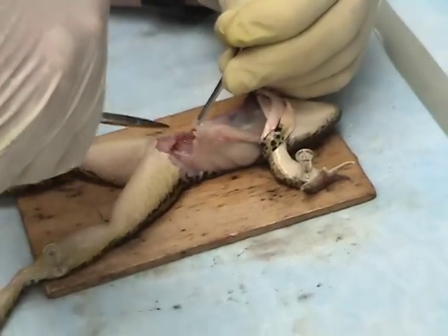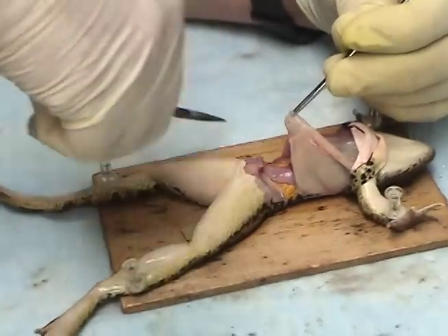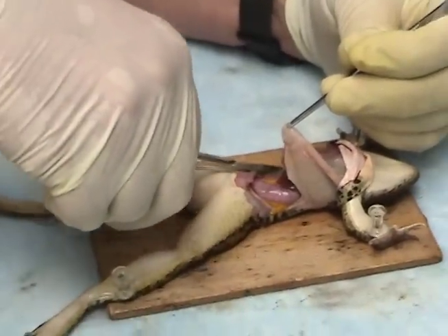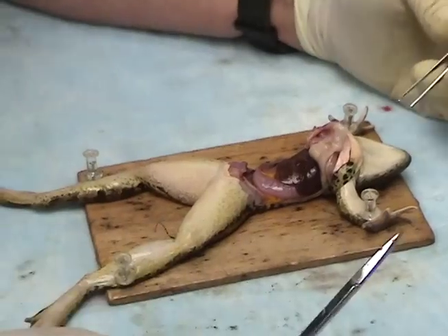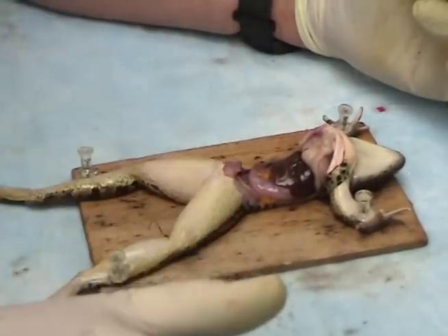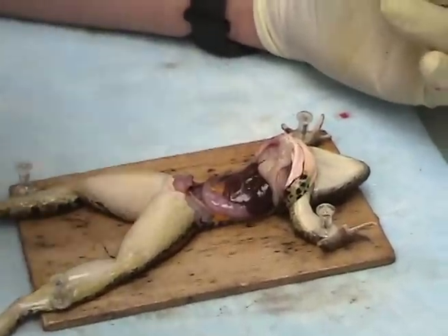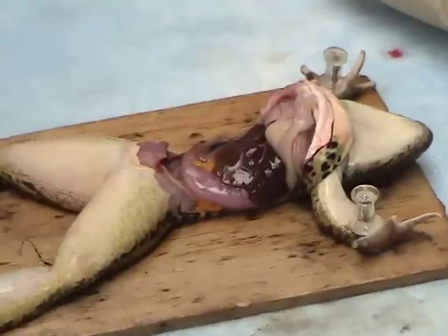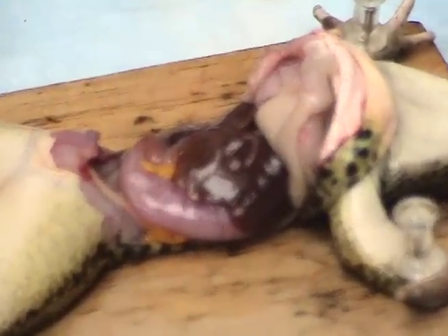It's well away from the heart here, just in case I mess up. You pith it and then you cut it up? Yeah, it's double-pithed. Basically, I just need to expose the heart. I'm gonna leave the heart in there, attached to all the blood vessels and everything, so it'll be pumping. Then we attach our probe to the tip of the ventricle, and as it contracts, it's going to be shortened in the lengthwise dimension.